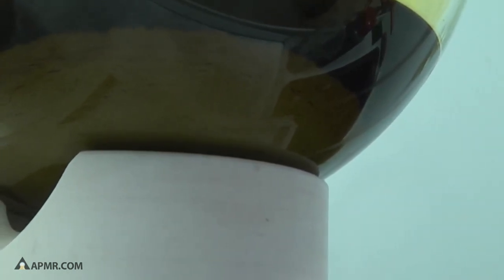This is what we want to filter out of the rest of the acid. The rest of the acid contains any gold, platinum, palladium, and any other metal that happened to be in that scrap.